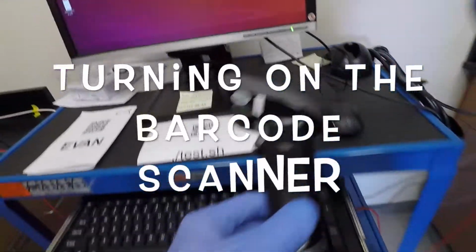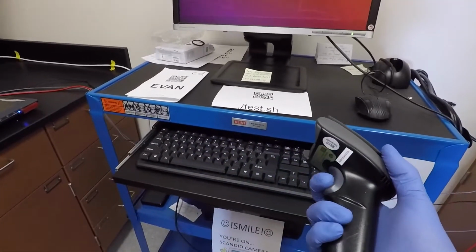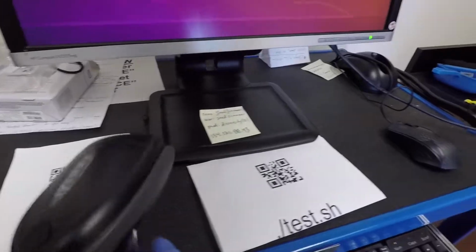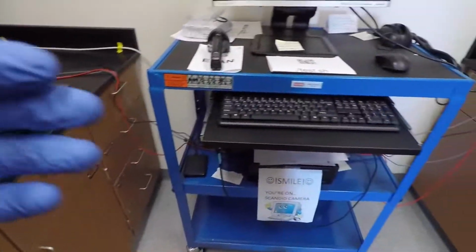I didn't mention this because it was already running, but to turn on and off the barcode scanner, you just hold down the trigger here. And there's actually a red dot in the center here, and that's how you can be aiming it at the QR codes. Turn on the monitor here for this computer, and this computer is running Linux.